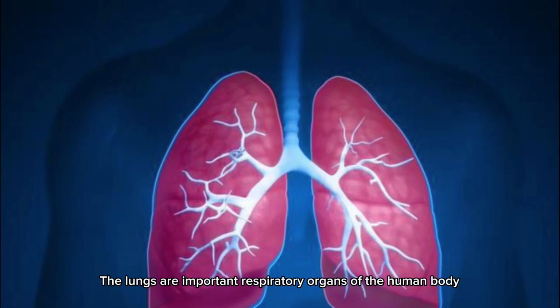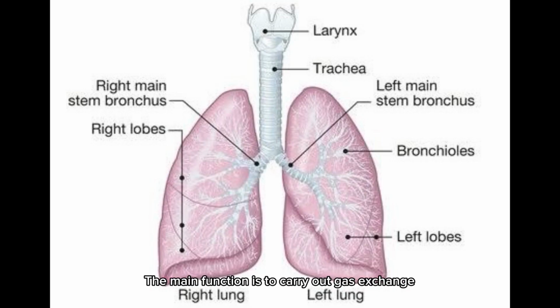The lungs are important respiratory organs of the human body, located within the chest, one on the left and one on the right. The main function is to carry out gas exchange, inhaling oxygen into the body. Carbon dioxide is emitted at the same time.